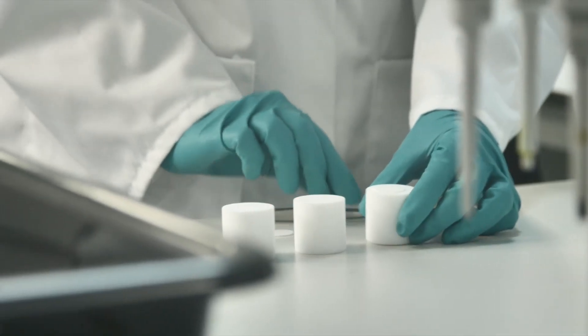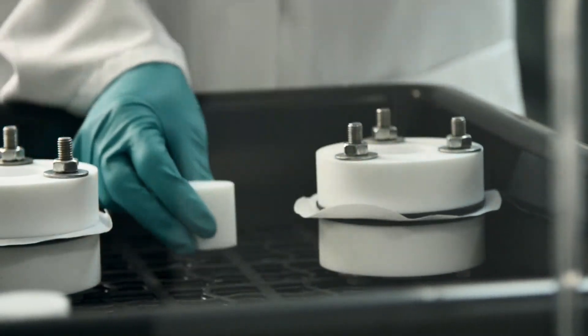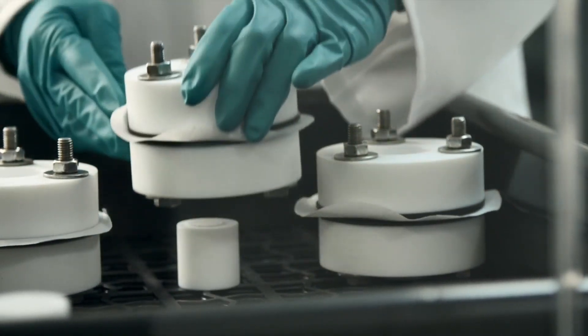From how much has been collected on the disc and the time intervals between taking the samples, we can calculate the permeation rate.